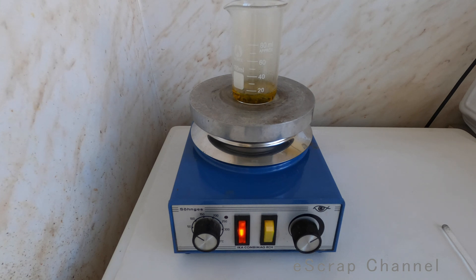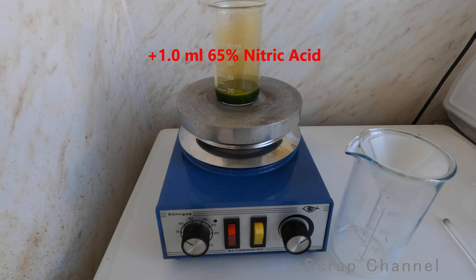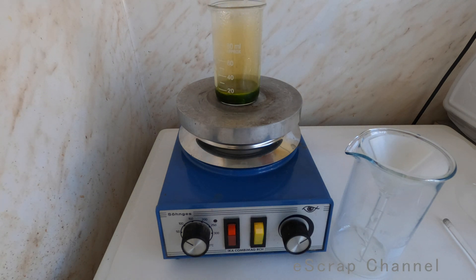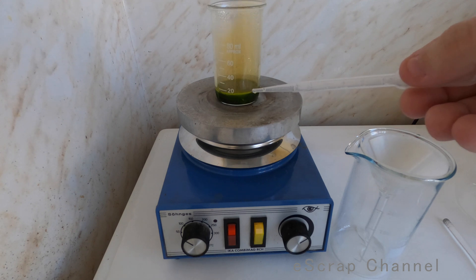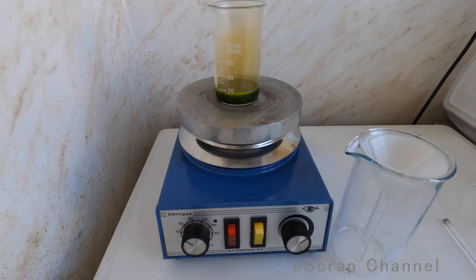I'll wait a little and show you the result — will all this stuff dissolve or not. Starting the ventilation now. We are almost there, almost dissolved. You see the color is not the nice yellow, so I will add one more milliliter of nitric acid just to be sure we'll dissolve all the metal. My calculation is that we'll probably need about three milliliters to be 100% sure we dissolved all the metal. So let's add half a milliliter more — we have three now. The whole process will take probably no more than 10 minutes.